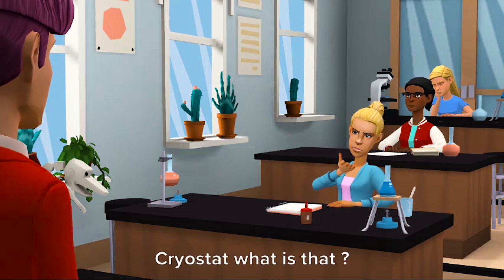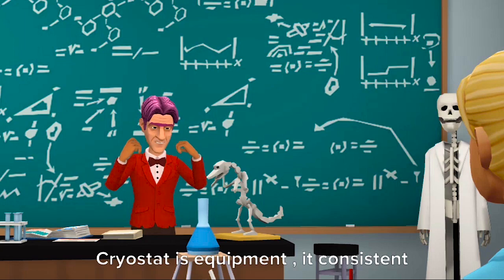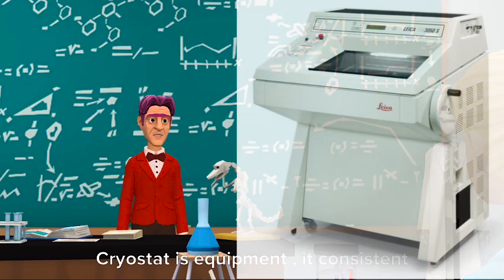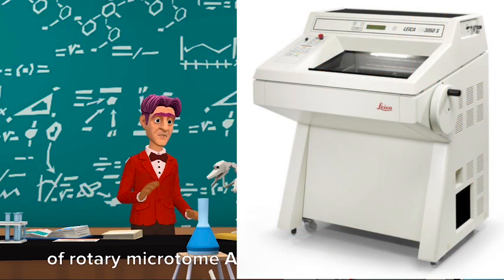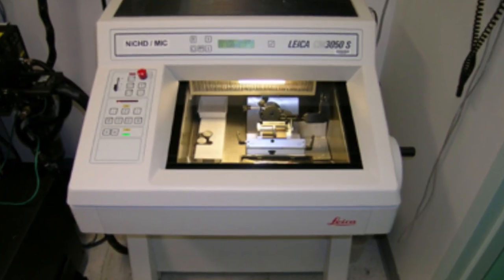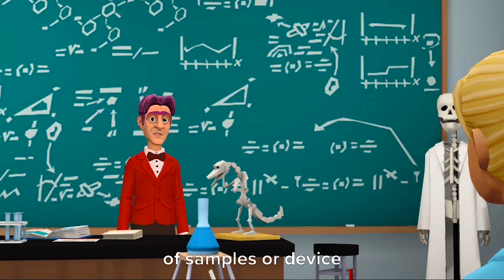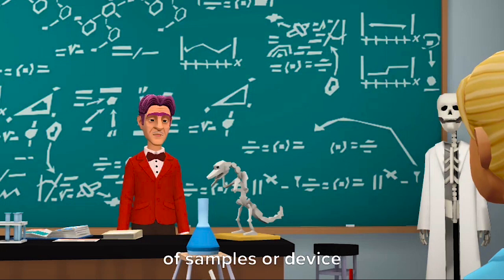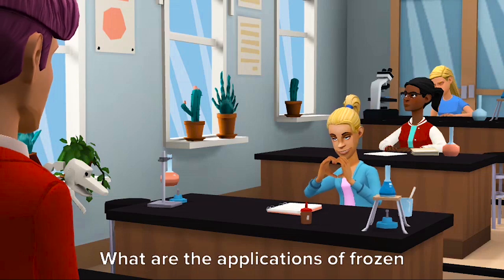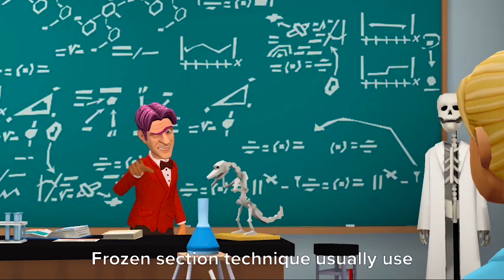Cryostat — what is that? A Cryostat is equipment that consists of a rotary microtome and a freezing unit. The Cryostat is used to maintain low cryogenic temperatures of samples or devices.